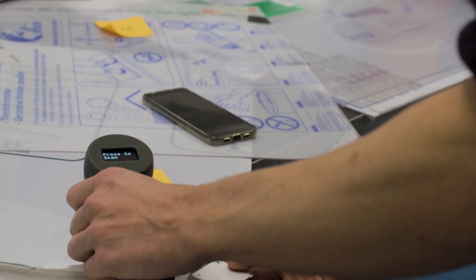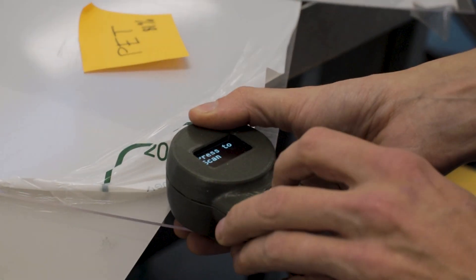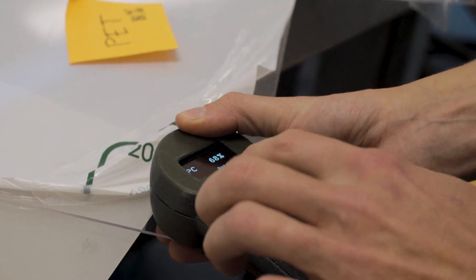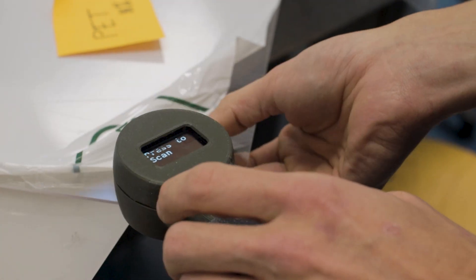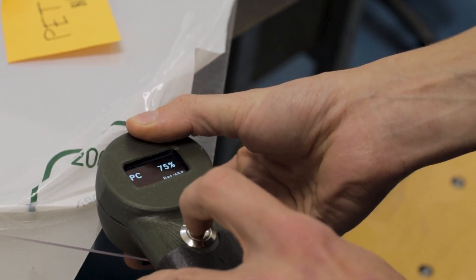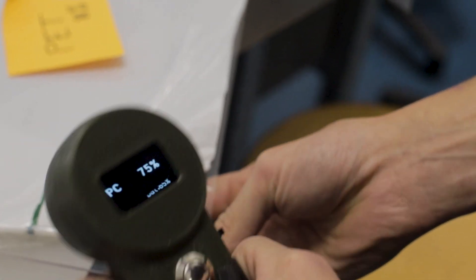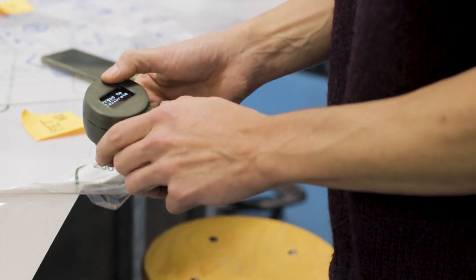Here we have one sheet where we peeled back the protective layer so we really have a scan on the surface. It says it's polycarbonate, but earlier we identified it as PET, so it's still not fully correct.